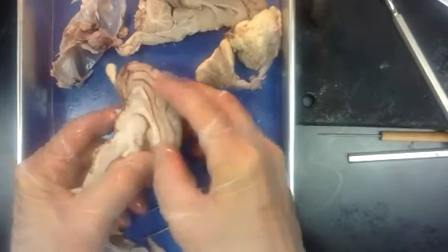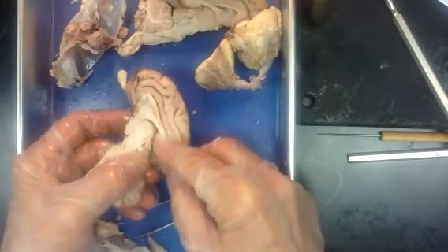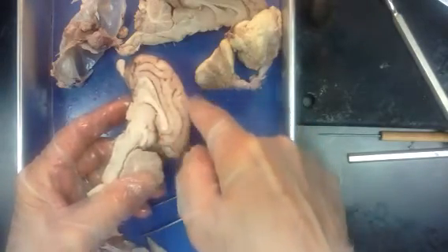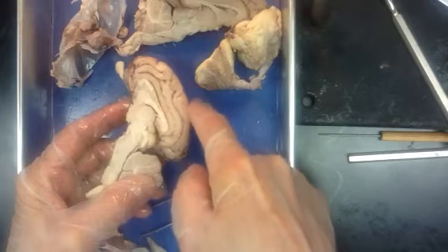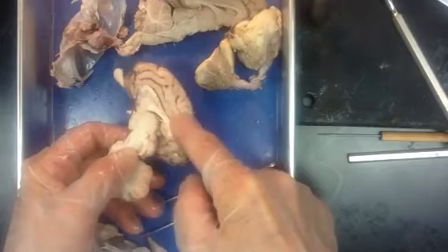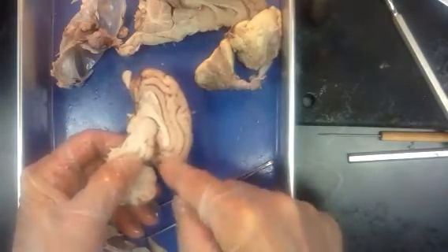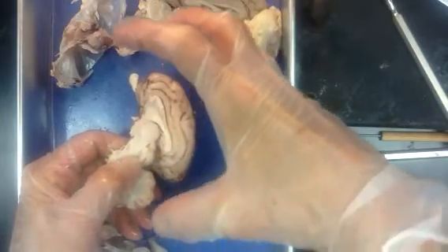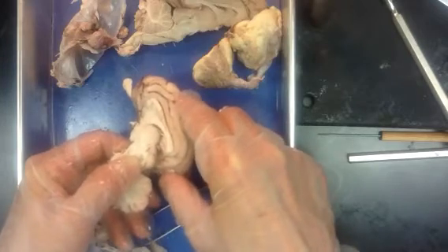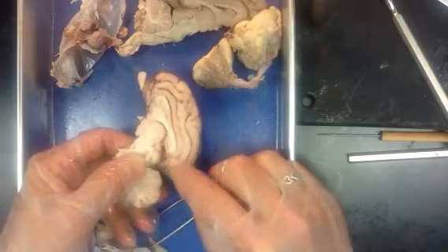That's the choroid plexus, where the cerebrospinal fluid is strained out of the plasma from the blood supply, circulated through the central nervous system, back up around the brain, and then out through arachnoid granulations up here, into the venous circulation, and back into the body again. If that gets blocked anywhere along the way, hydrocephalus can result, where the fluid builds up and alters the size of the cranium. It stretches the cranium out as it's developing. If you don't relieve that pressure at some point, it could be fatal.